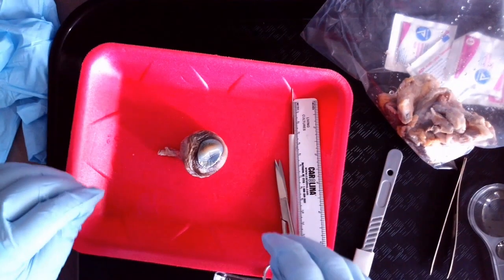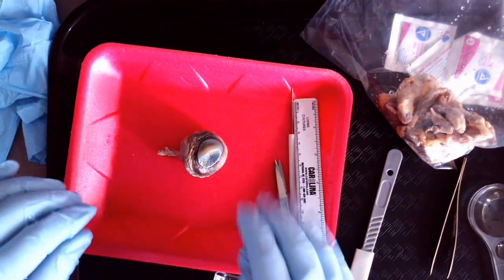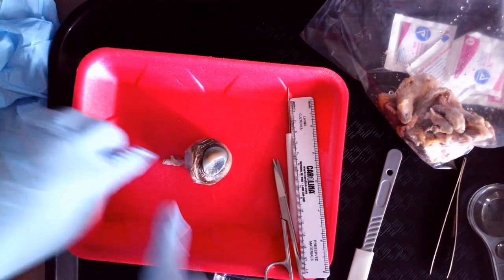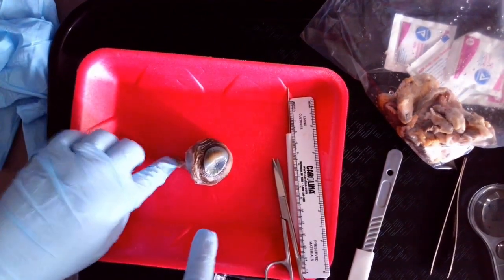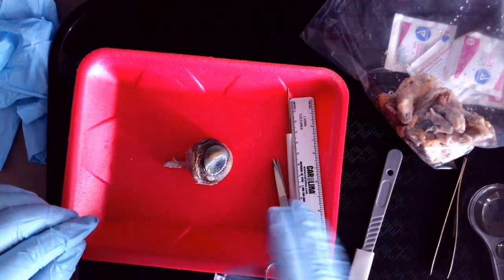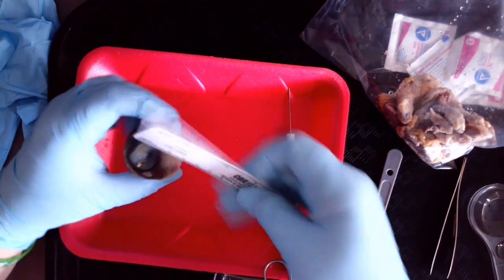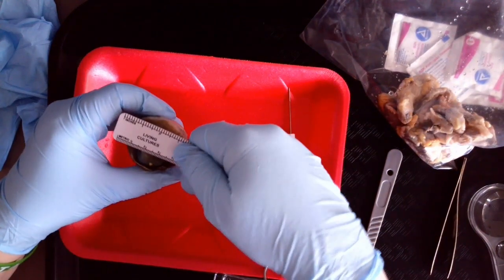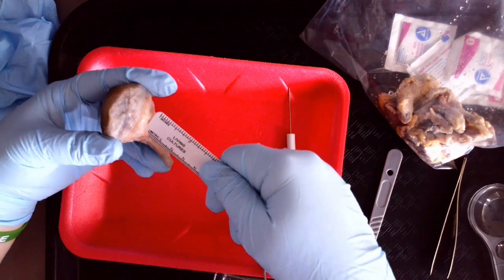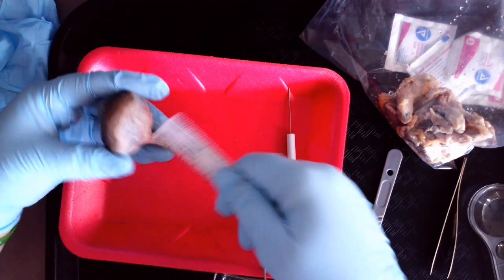This is the end of the external anatomy. Remember you were relabeling the optic nerve, the cornea, and the sclera with the pins. You were doing diameter across the eye and then you were doing the length of the optic nerve that was preserved.